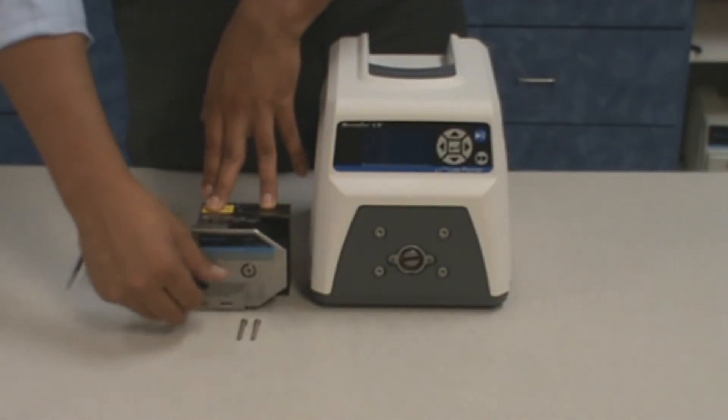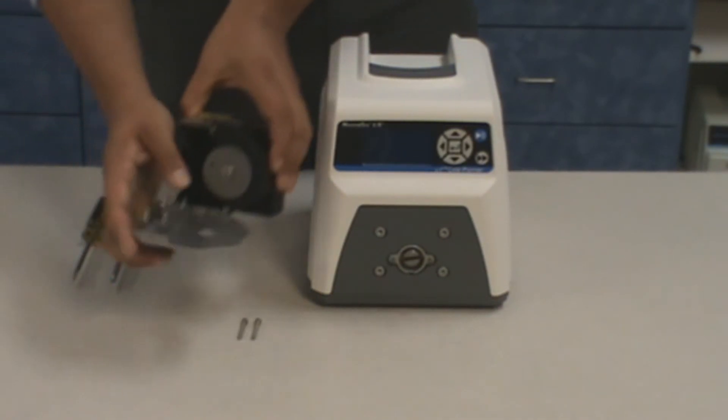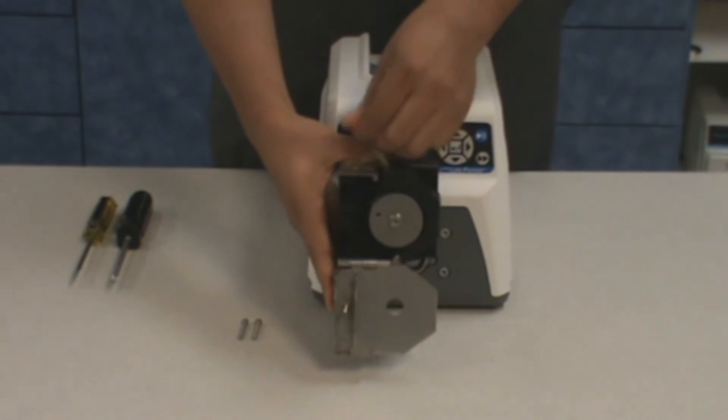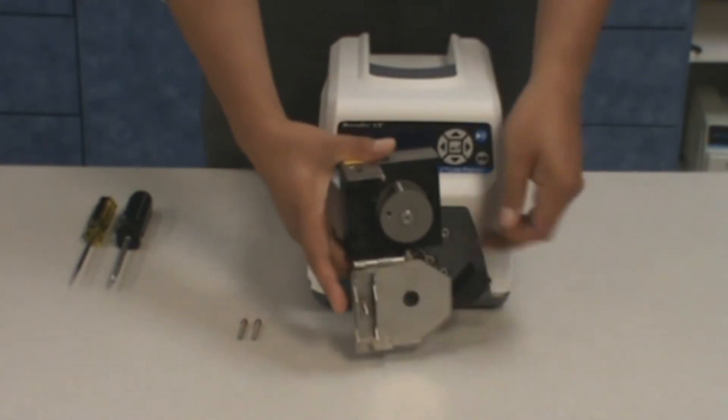The first thing you will want to do is check to make sure that the drive is turned off. Always make sure the drive is off before mounting or removing your pump head as well as installing or removing your tubing.